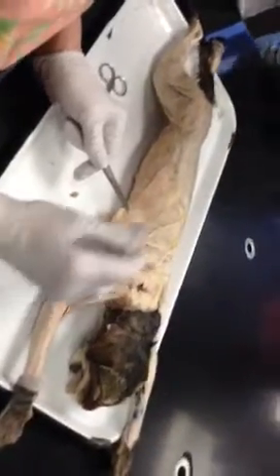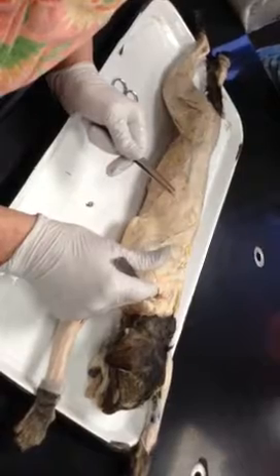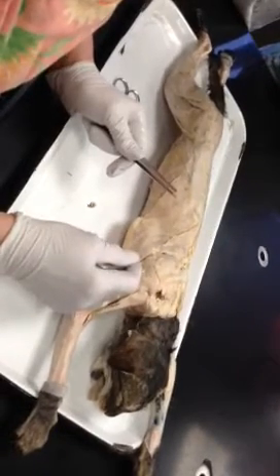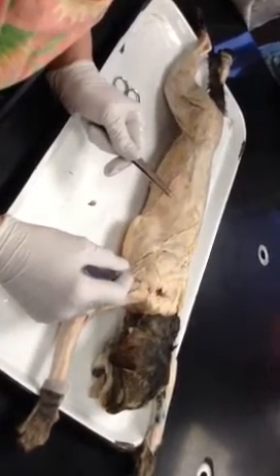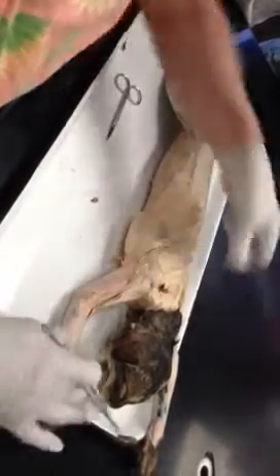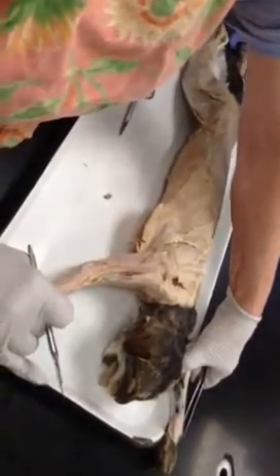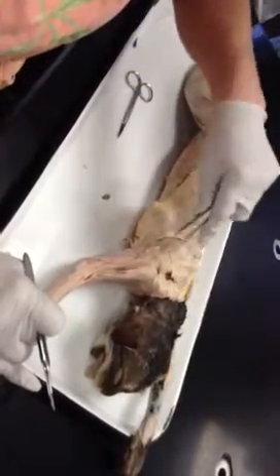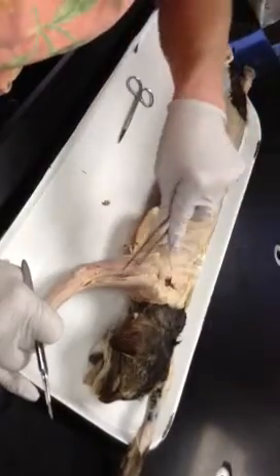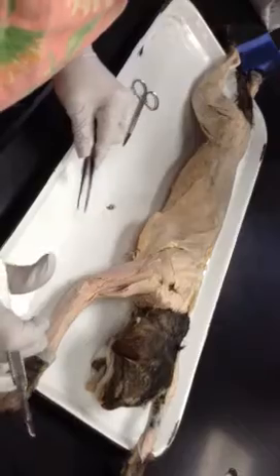Deltoid. Spino, acromio, clavo trap. Spinal is a rectangle, acromio on the deltoid is a triangle, and this clavo gets one name for 3 locations. Trap is in the neck, delt is here, and this is clavobrachialis. Okay?